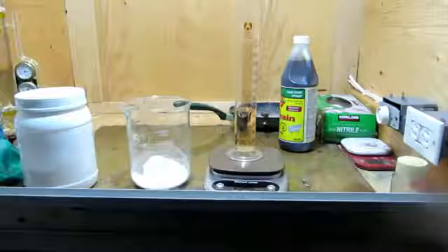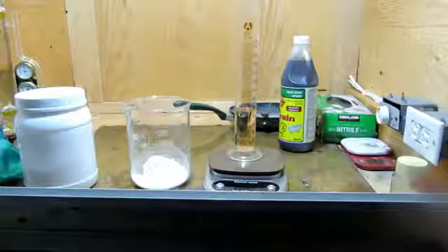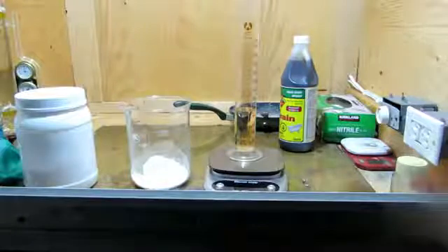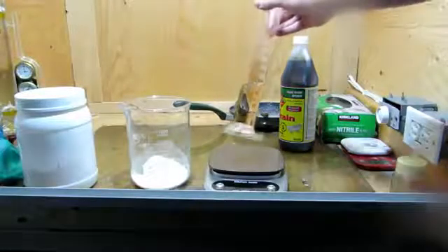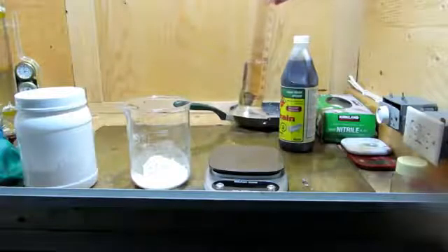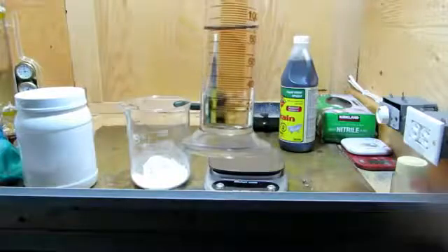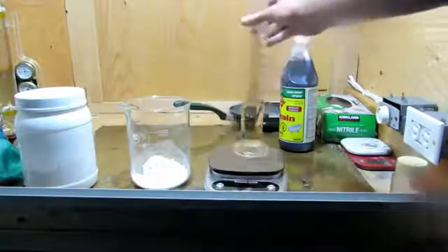So, for this reaction to begin, we're going to be needing to add 79.1 grams of calcium phosphate and 80.7 grams of drain cleaner, and we're going to be adding some water to this to help have everything dissolve a bit better. So, the calcium sulfate formed will be insoluble and should precipitate out, so we could filter that off.